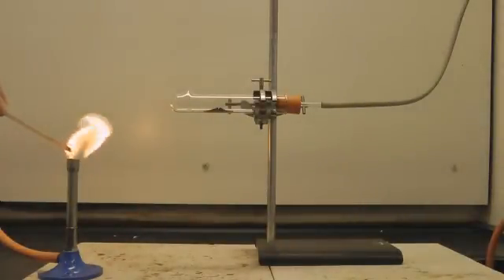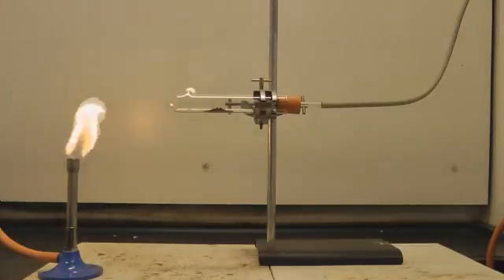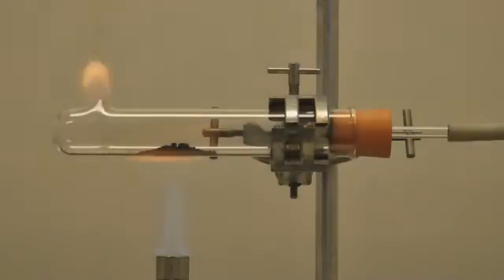The methane coming out of the hole in the bottom of the tube is ignited using a splint. The copper oxide is then heated with a roaring blue Bunsen flame.